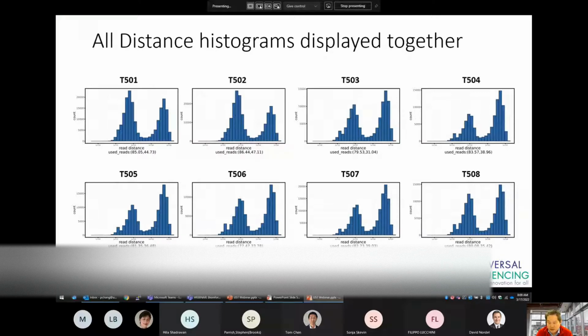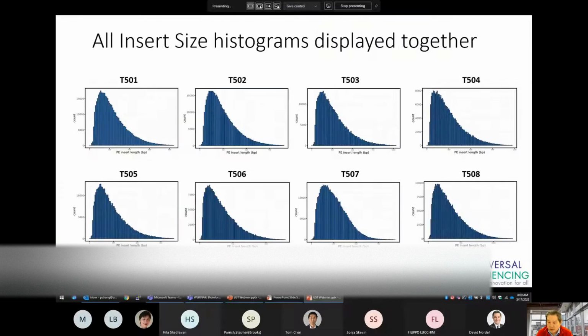For these 8 samples, 501 and 502 shown in the upper left have good distributions, while the others can be further optimized to reduce the amount of DNA per tell bead. You can also look at the insert size of these reads. Here you can see that 502 and 507 have longer insert sizes than the other libraries.